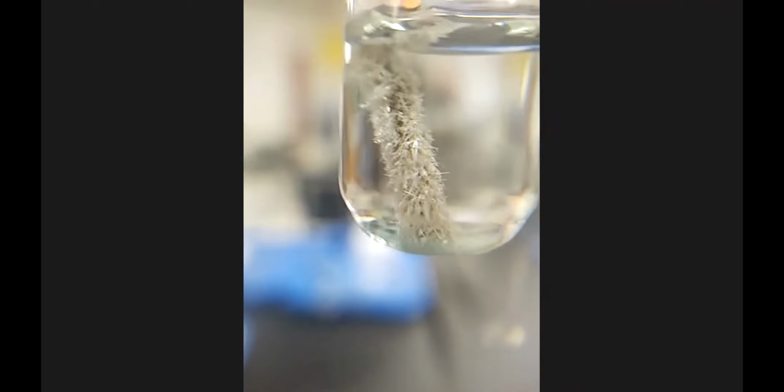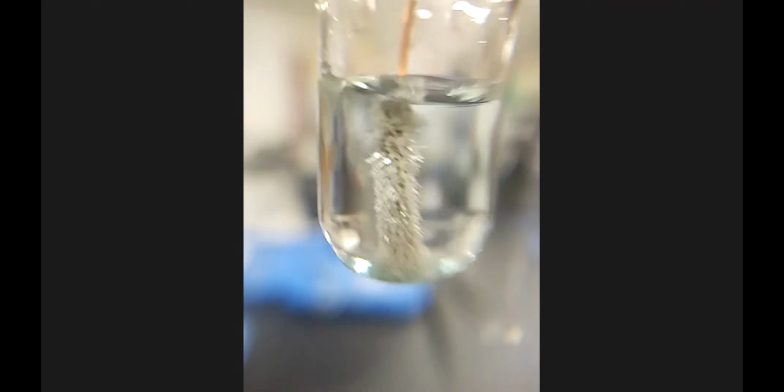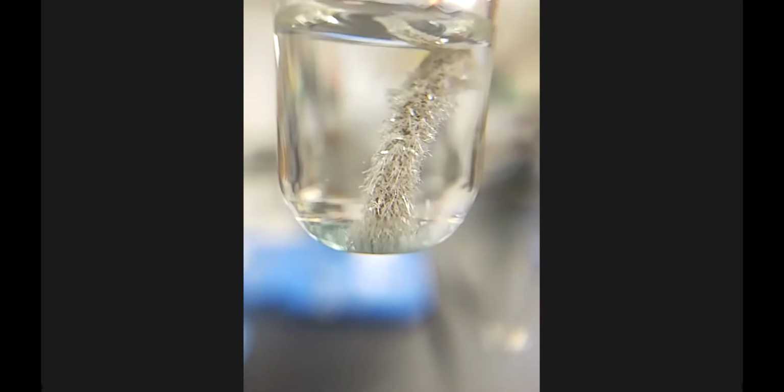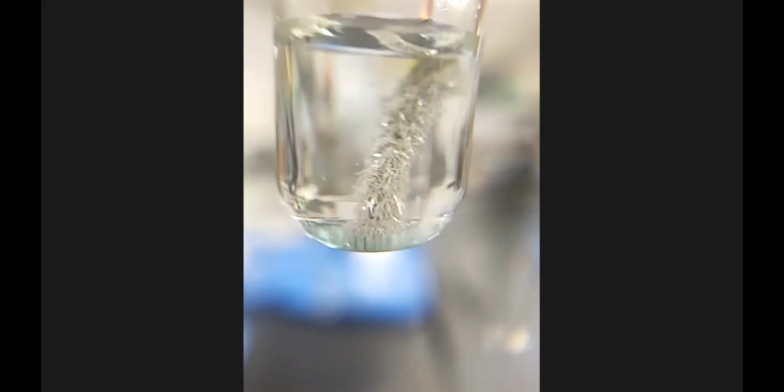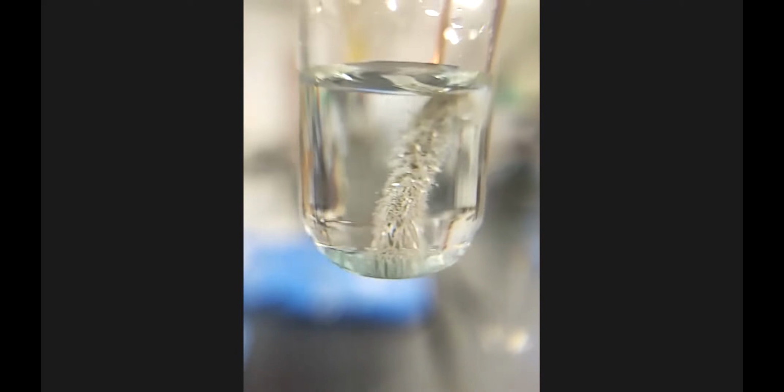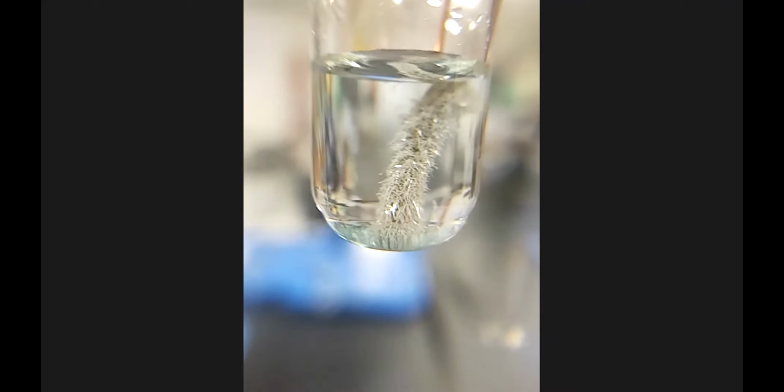So that is the silver nitrate solution with the copper wire. Yeah, this is about as pretty as it's going to get. I will show it to you another 10, 20 minutes. And hopefully you can see that slight hue to the solution as well. I'm going to hold up another one here in just a second for comparison purposes, but you can kind of see that.